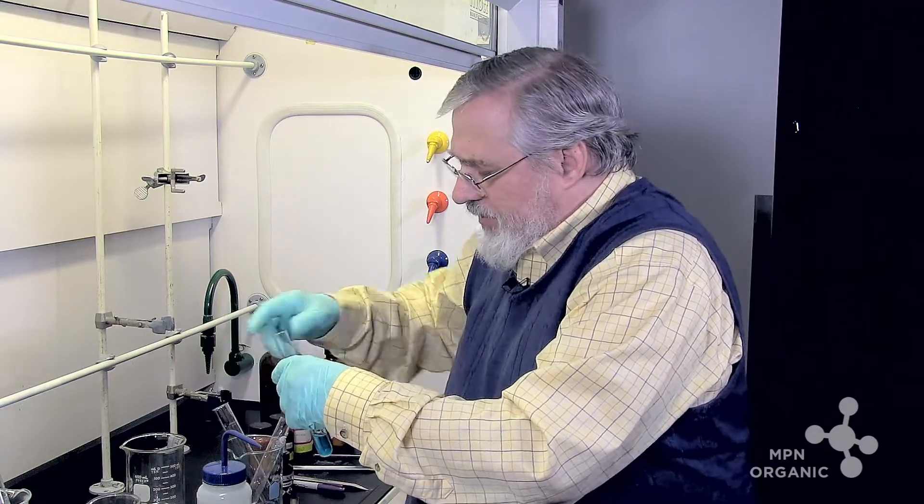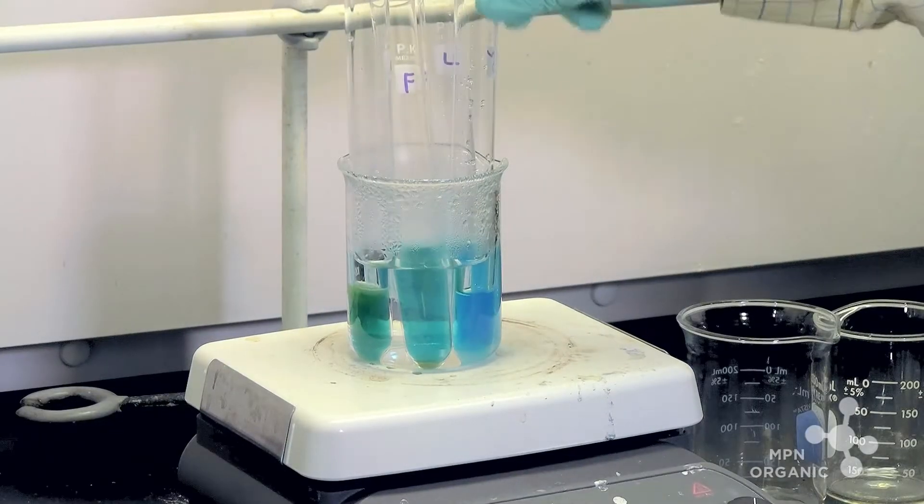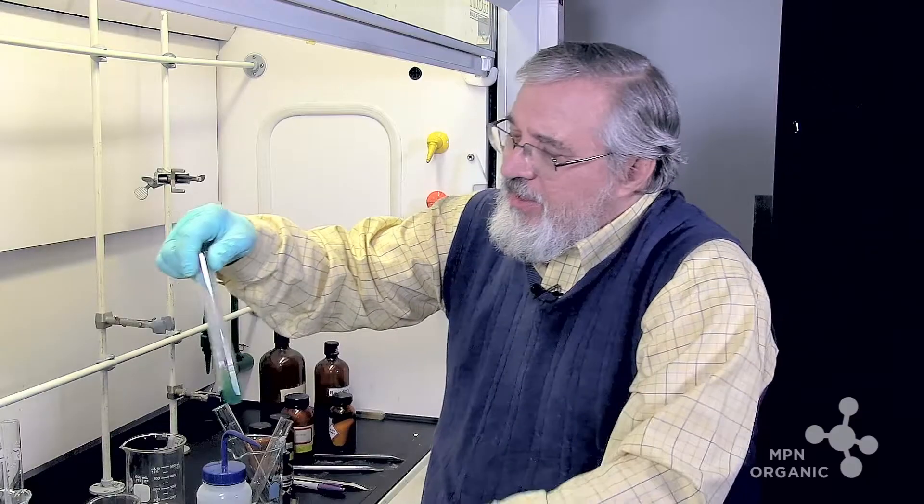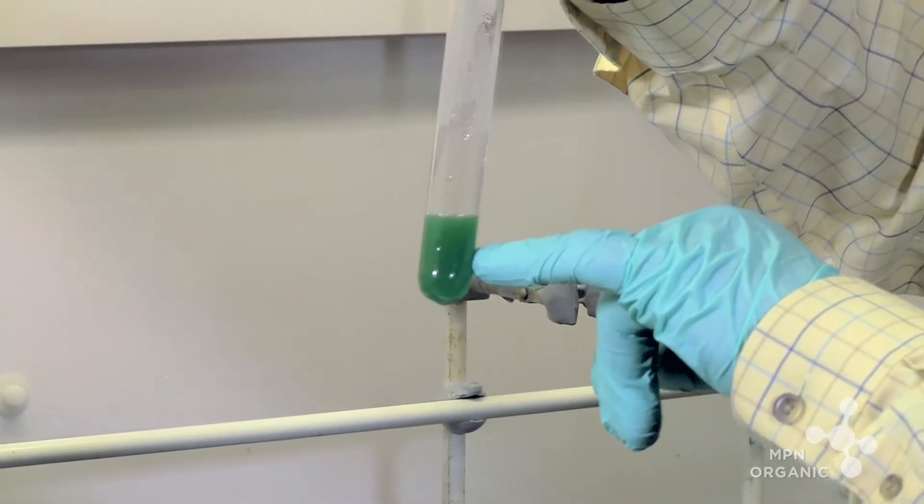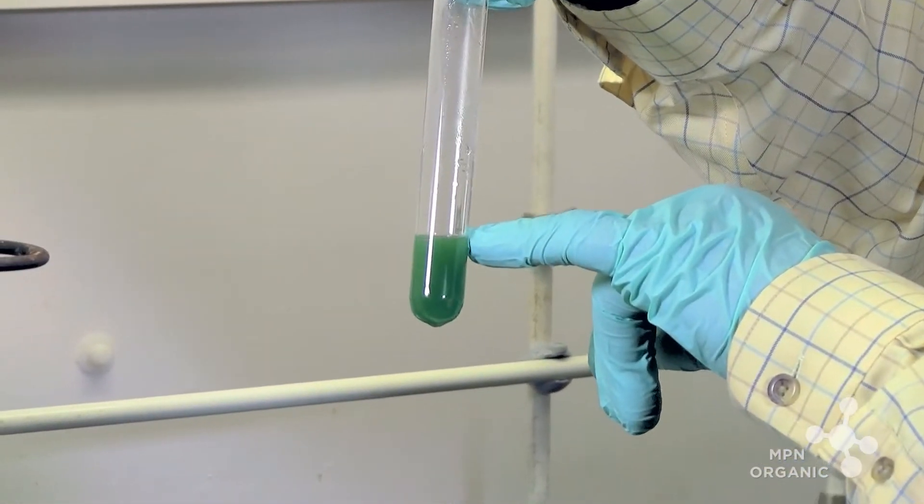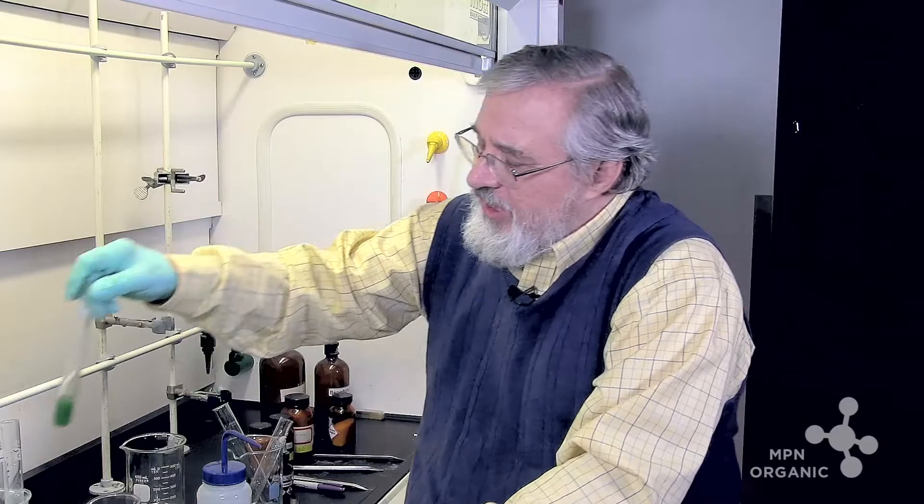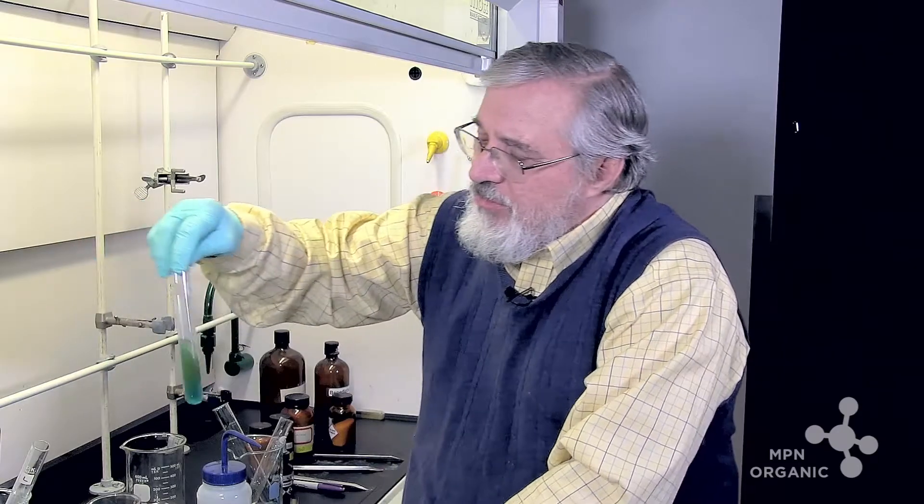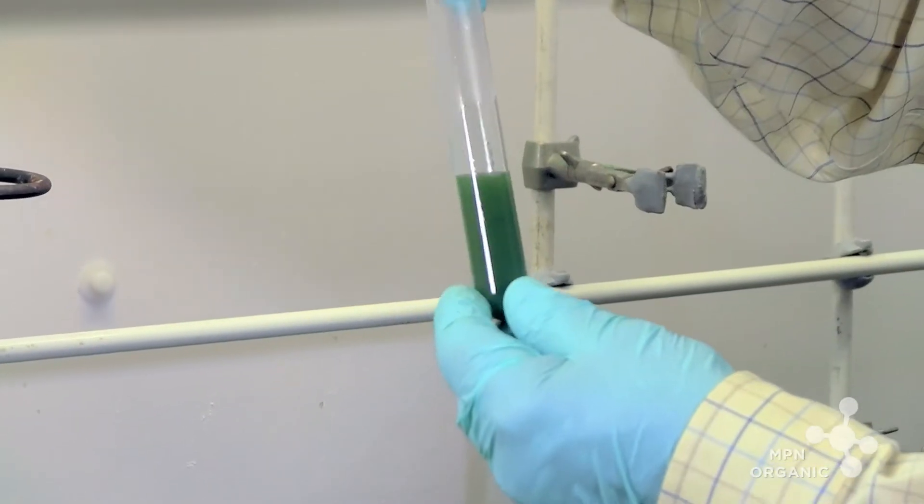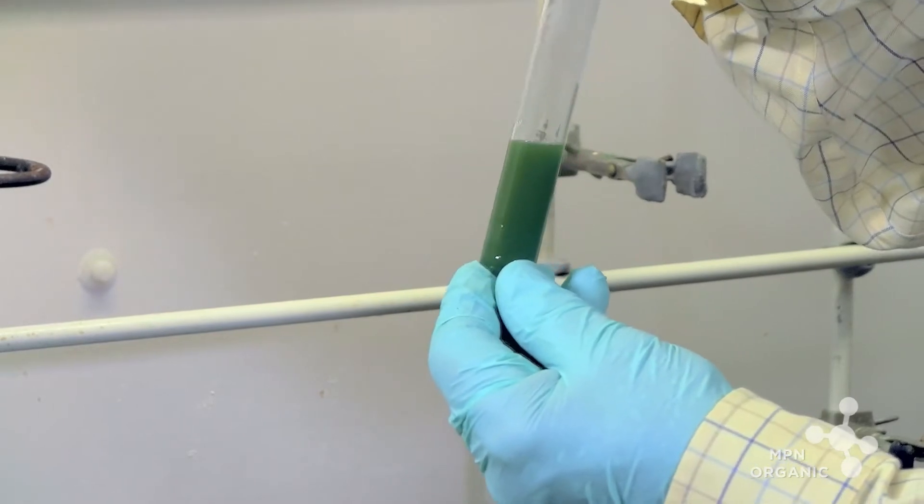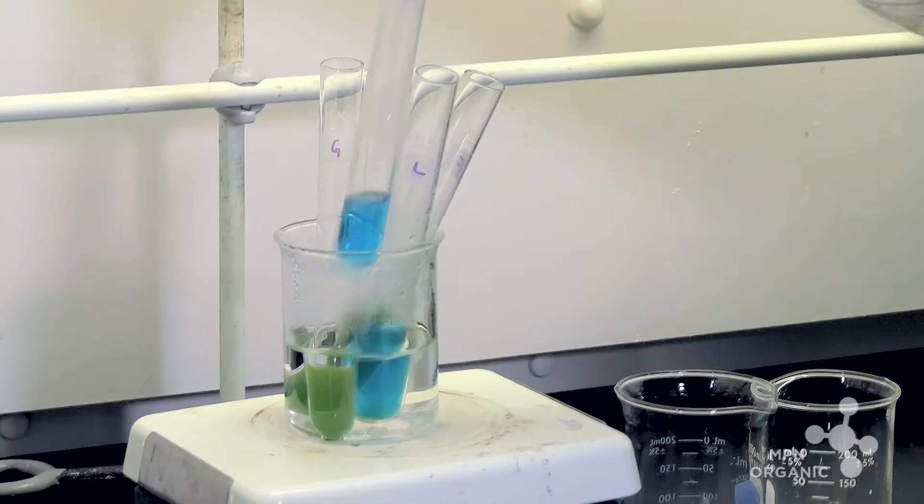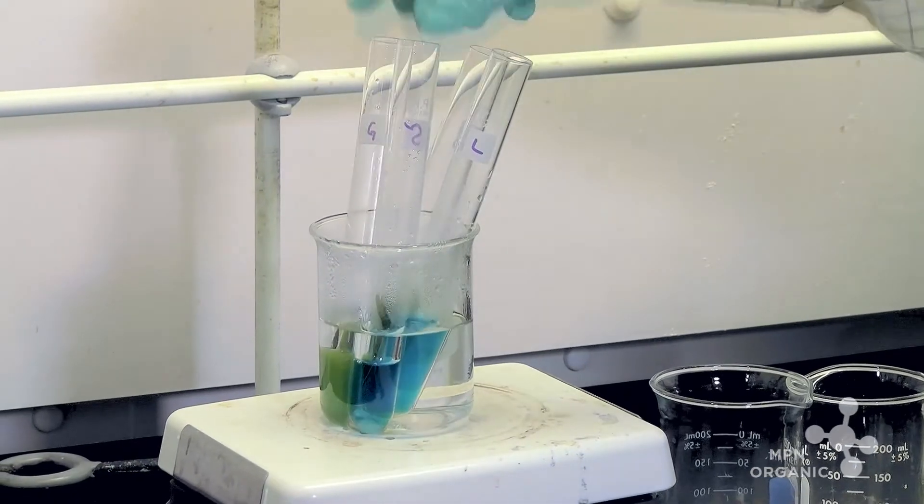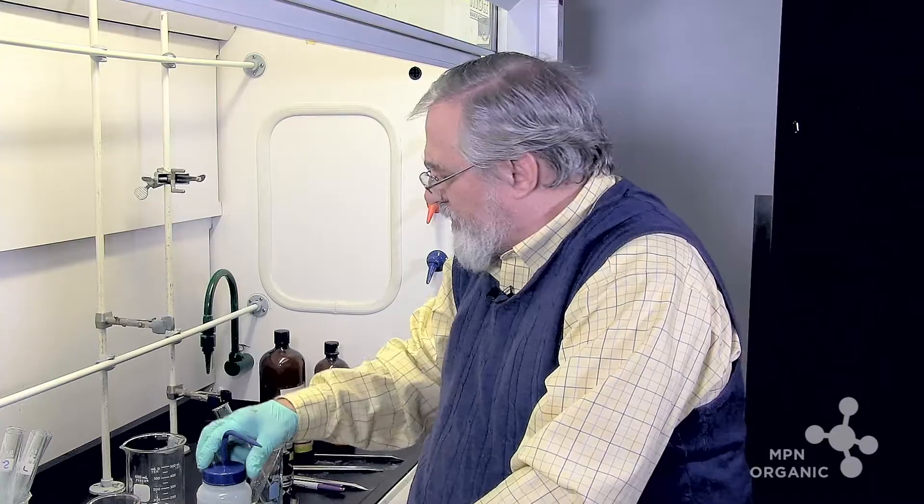It's going to be very obvious what the reaction will indicate. Now you can see that glucose is starting even now to show a kind of an orangey precipitate, which is characteristic of a copper one oxidation state. In fact, fructose is the champion of these. It goes very fast and it's starting to turn this color. Lactose is slow. Sucrose, nothing seems to be happening. Let's just let them go for a minute.